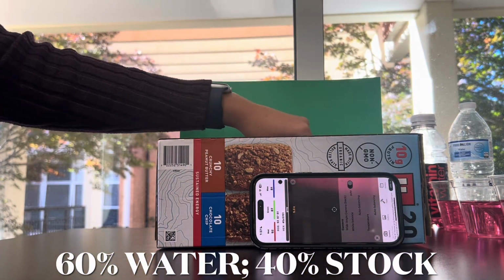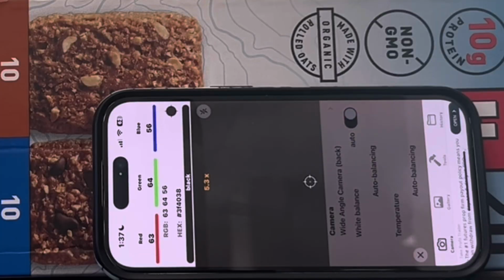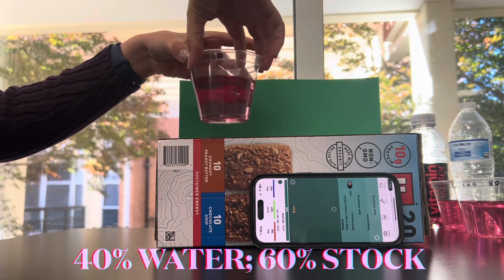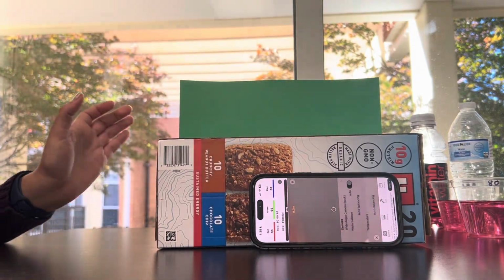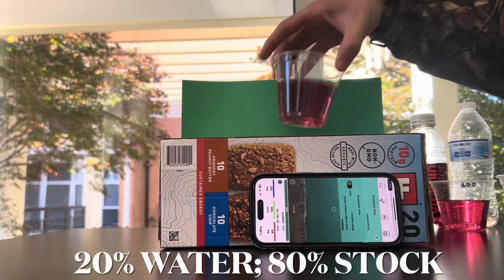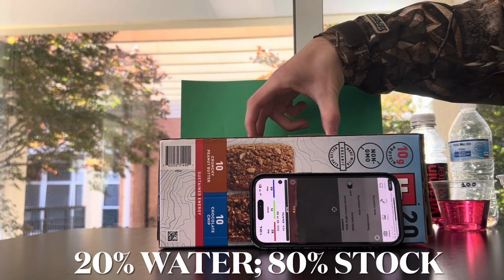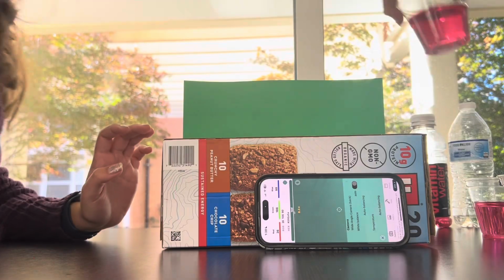I guess just to make sure it's aligned. Here our value was 64. Do I blank it? Yeah, 103. Okay, 69.